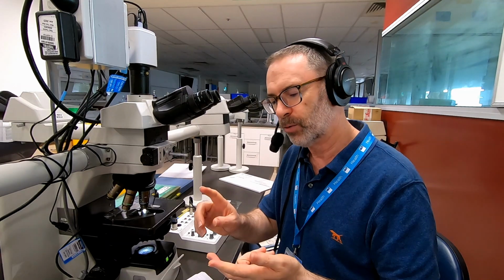Okay, so what I'd like to spend the remainder of my time this week is actually looking at reactions that can be used to create color other than the brown yellow pigment that we see. So whether we're talking about bile pigment, which is kind of brown yellow, or hemosiderin, which is quite brown, or melanin that's quite brown, there may be some morphological and contextual features there that help us to identify what those things are.